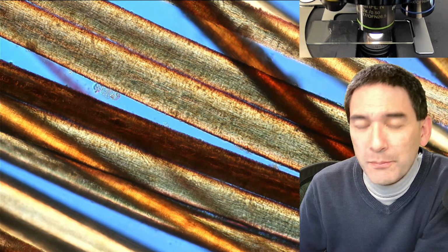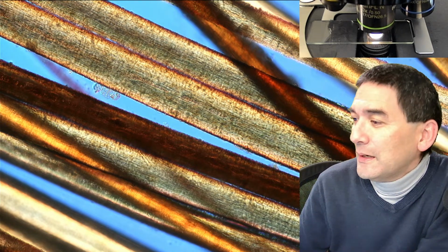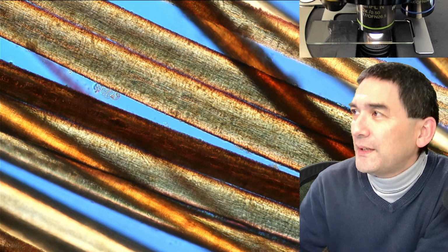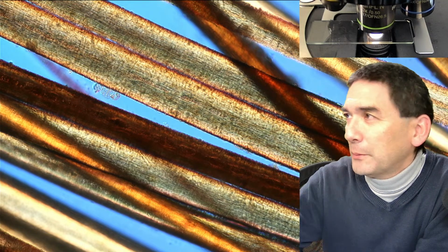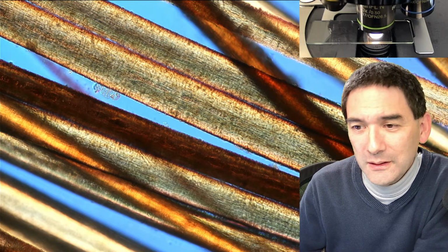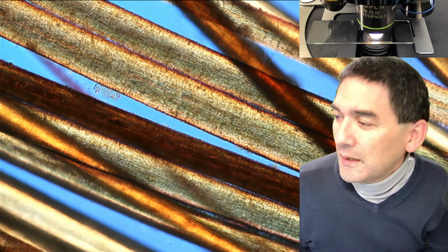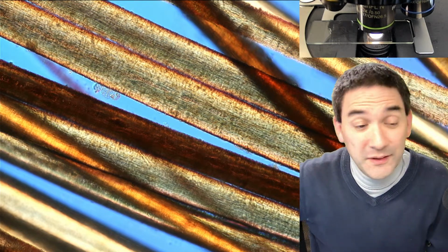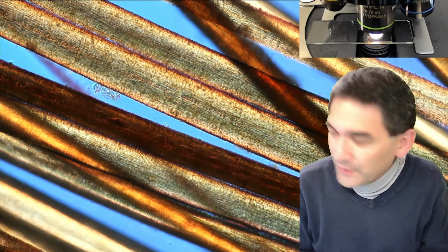How would you adjust parfocality? The thing is the following. My microscope is parfocal, but it's not properly adjusted with the camera. I think that's the problem I have right now. I have to simply adjust the distance of the camera, and then it's going to work again. I haven't done this yet. That's something I just wanted to show you a little bit.